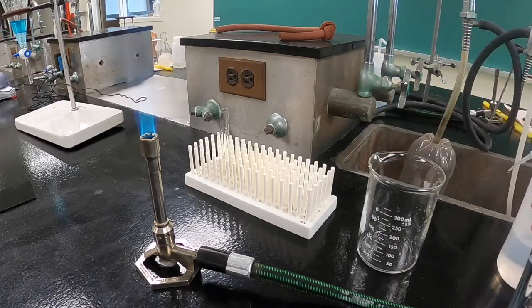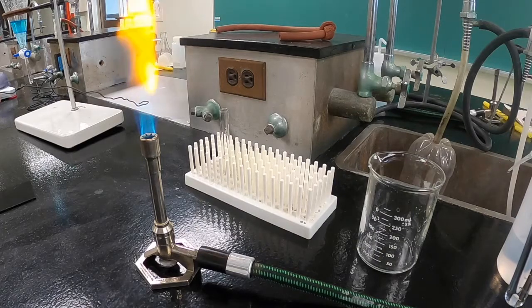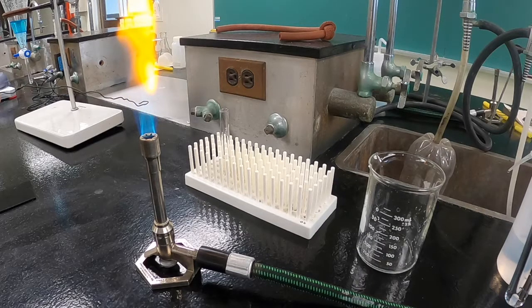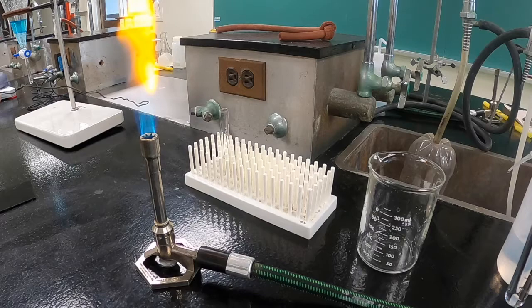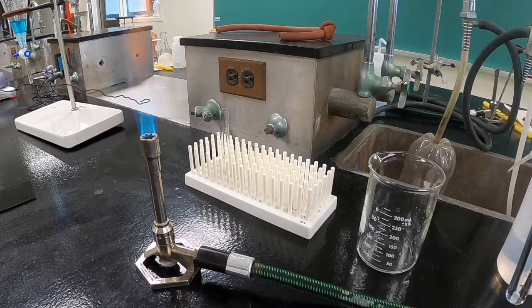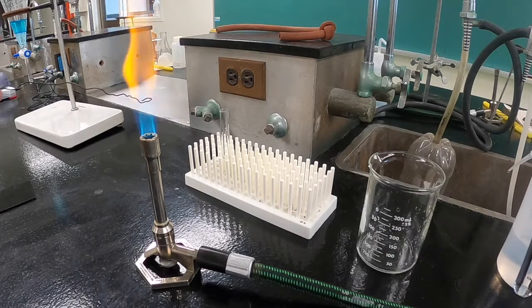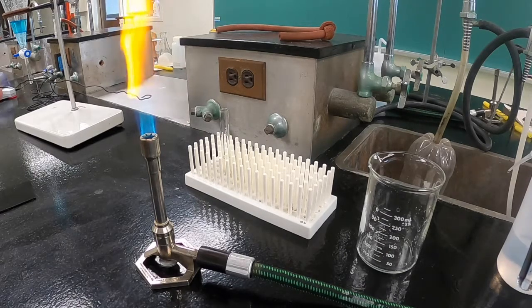You then place the tip of the wire into the flame and observe the color. You should be able to observe for this sample that the flame is a much brighter yellow than it was before the solution was added. Prior to adding the solution, the flame color had stabilized to an orange. And now it's yellow.